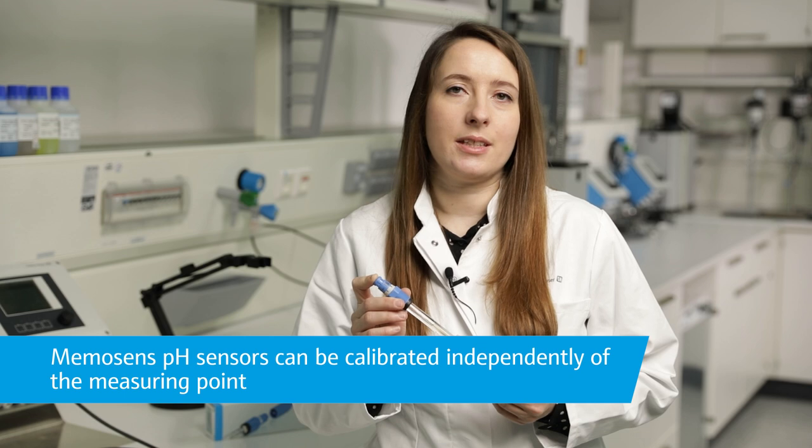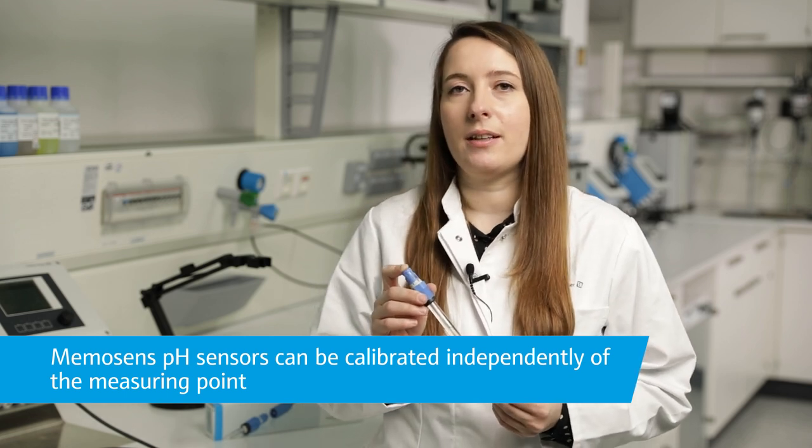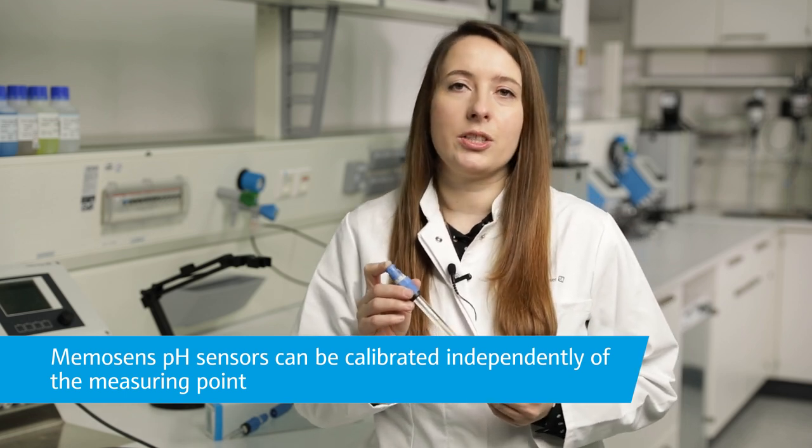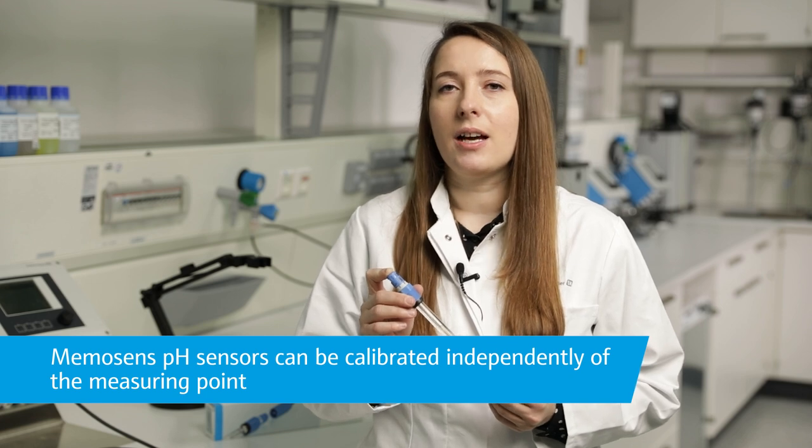Thanks to my pH sensor with Memosense technology, there are no problems with water or humidity. A potential matching is not necessary and calibration can be done in the lab. All calibration data and sensor information are stored directly in the sensor itself.